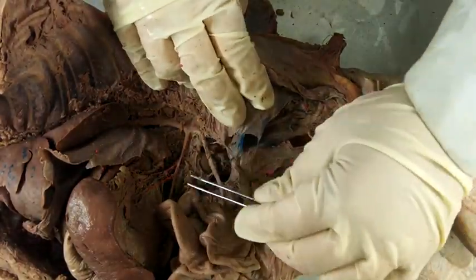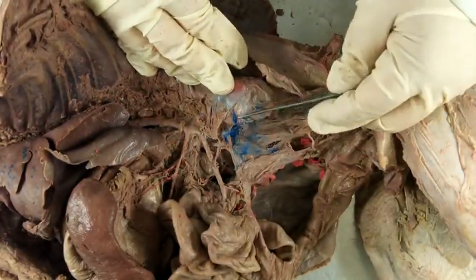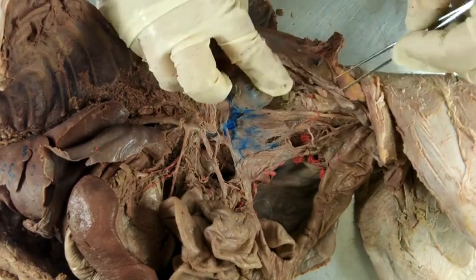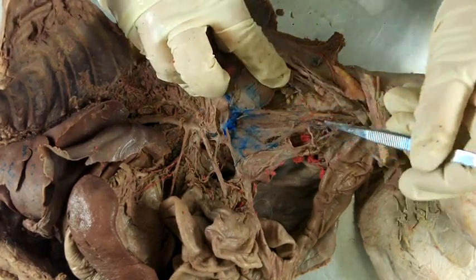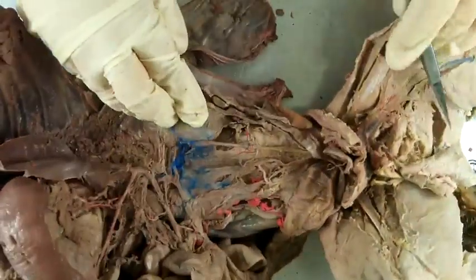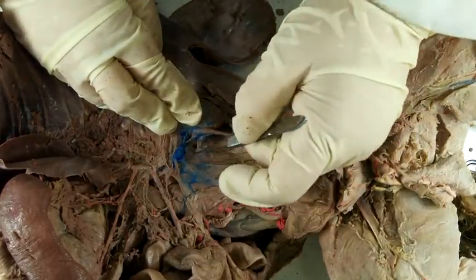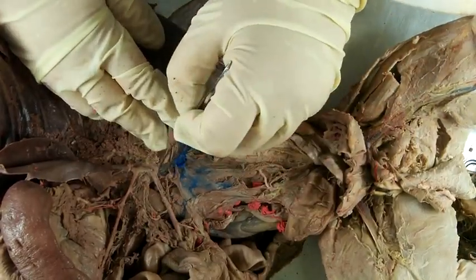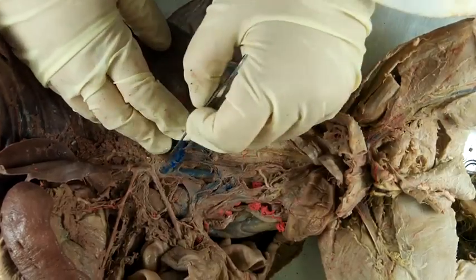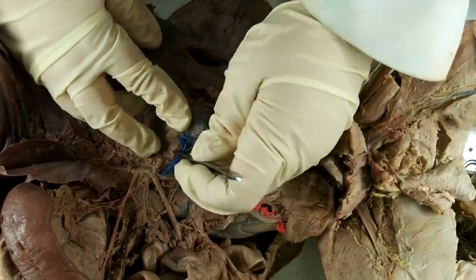I'm going to cut through the peritoneal layer to expose the kidney. Remember, there's the kidney and the ureters. And notice this very delicate vessel, artery. That's going to be the ovarian artery. In females, the spermatic in males will go in a different direction, but should be seen at about the same level. Again, depending on quality of injection, some of these may be clearer to see than others.